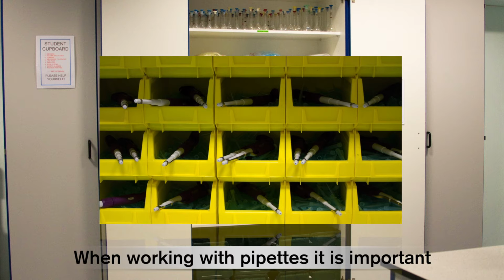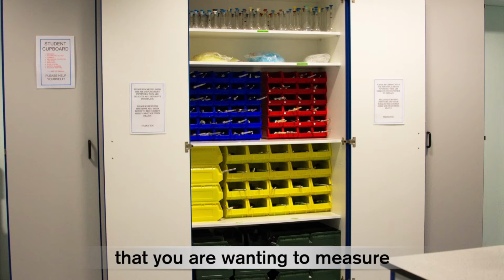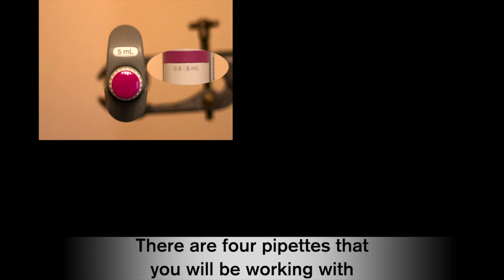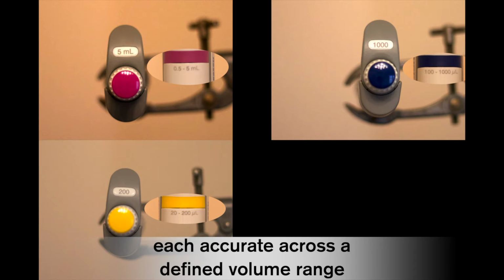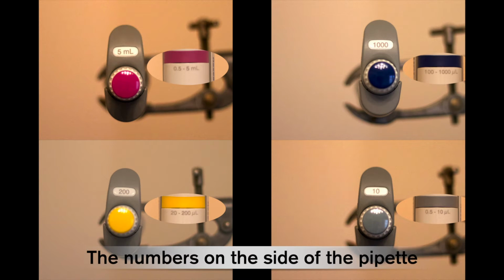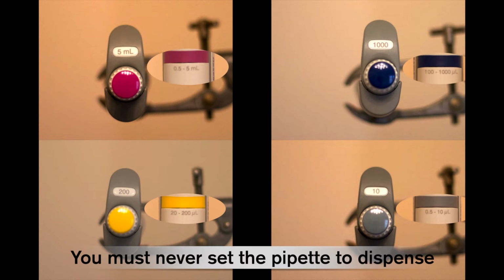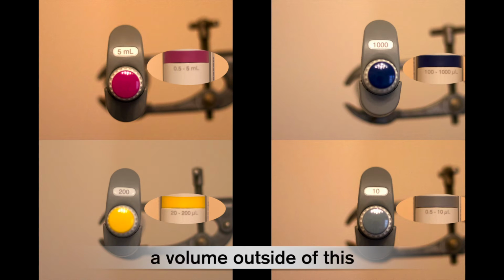When working with pipettes, it is important to select the correct pipette for the volumes that you want to measure. There are 4 pipettes that you will be working with, each accurate across a defined volume range. The numbers on the side of the pipette give you the volume range over which it can be used. You must never set the pipette to dispense a volume outside of this.